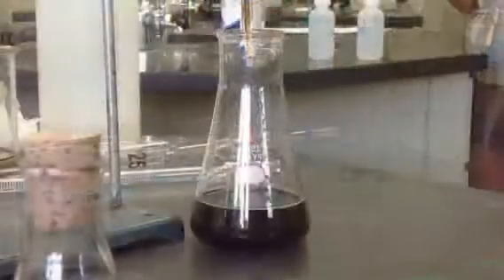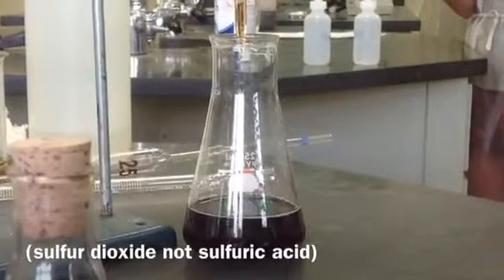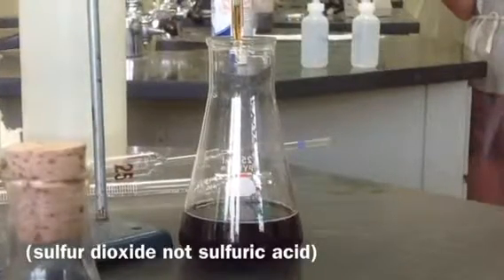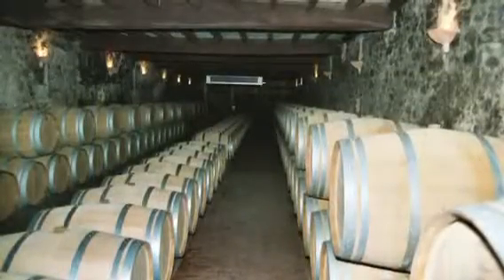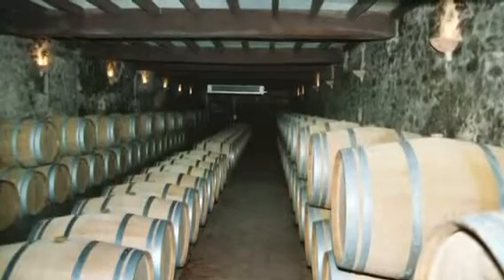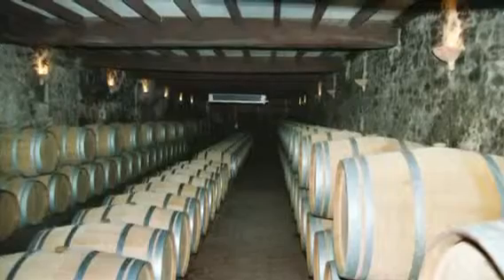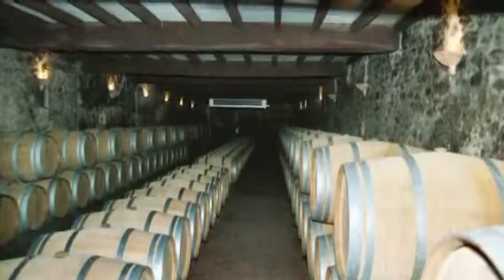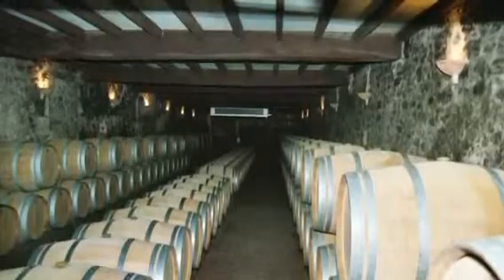After combining the amounts of free SO2 and combined SO2, the total amount of sulfur dioxide in the wine sample was around 141 parts per million. The legal limit for total SO2 varies from one country to another, but 250 parts per million is a commonly accepted value. And although there is no legal limit on the amount of free SO2, levels from 20 to 40 parts per million safeguard the wine without affecting its taste.